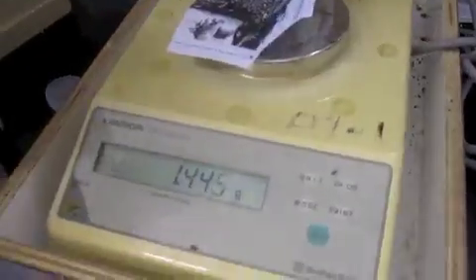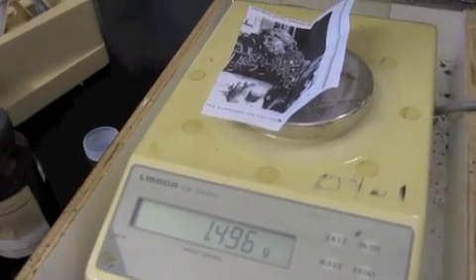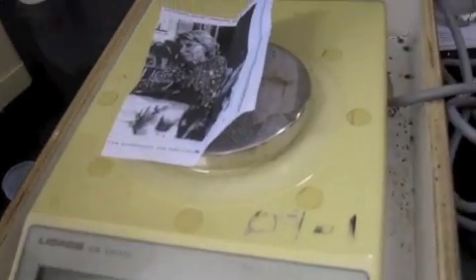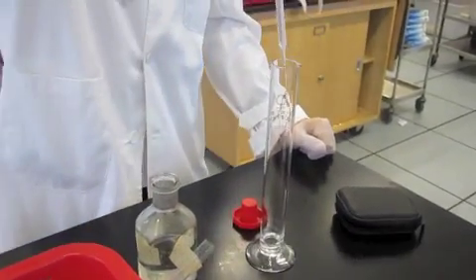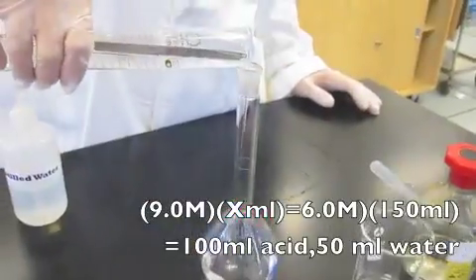Next, we massed out 1.5 grams of each of the metals, zinc, iron, and calcium. We tried to get the sig figs as close to 1.5 as possible. We did not have enough 6 molar H2SO4, so we had to do a dilution experiment with 9 molar H2SO4.